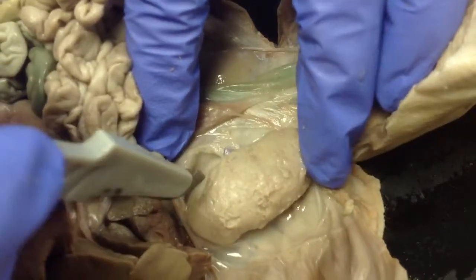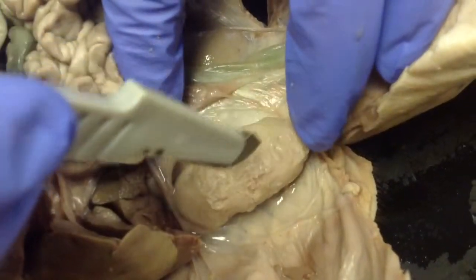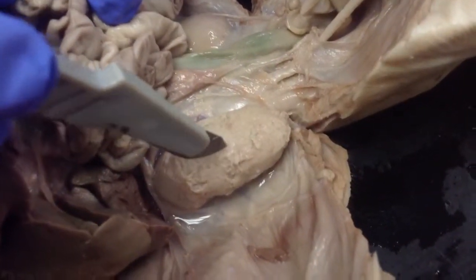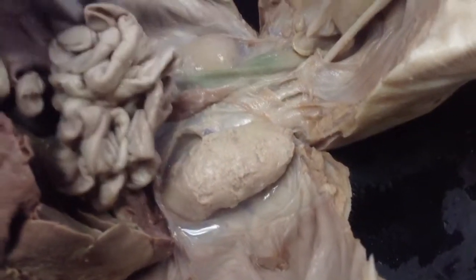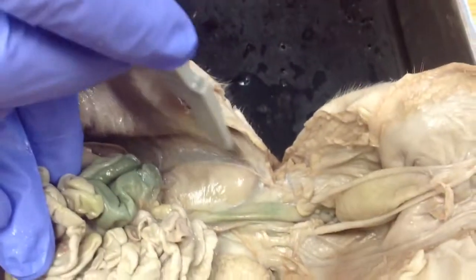And remember, the kidney's job is to filter the blood. So all the blood flows through the kidneys, and then any toxins or any waste that are produced by the cells, get filtered out and sent to the bladder to be released as urine. Okay, you come over here, there's the other one on this side, right there in that same sac.